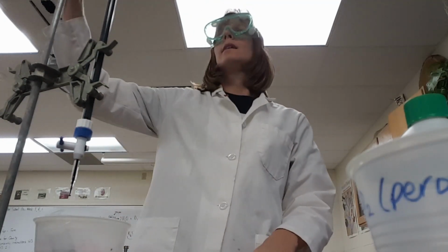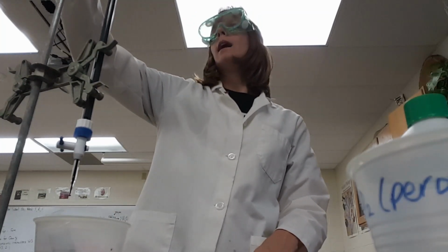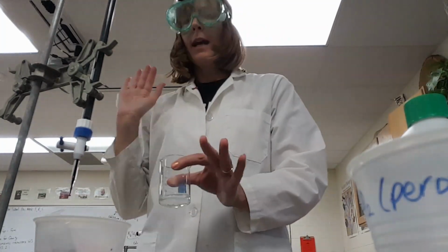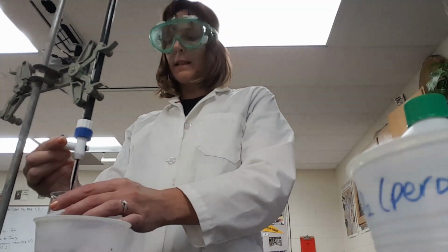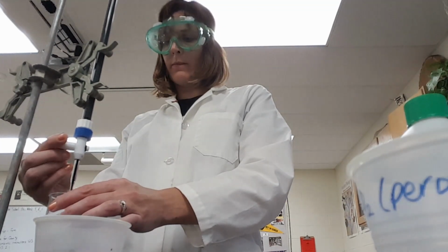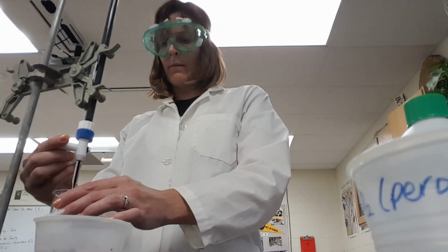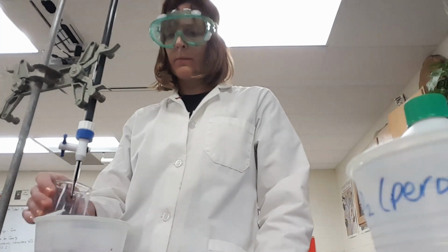All right, so once again, you should always measure where you're starting. Now I'm starting where I ended, so I'm at 11.6. All right, ready to go here with my 10 milliliters that has been transferred. And I'm going to be careful this time and see where we're at. I was careful last time too. That was actually pretty good titration. Okay. Let's see if I can get it to go drop, drop, drop. There we go. Swirling.